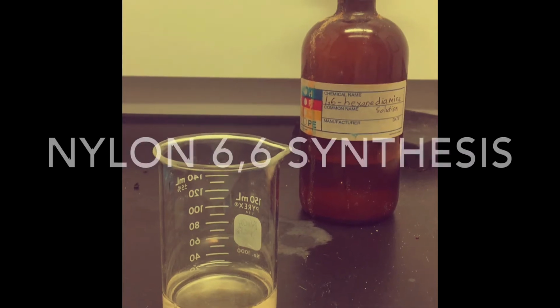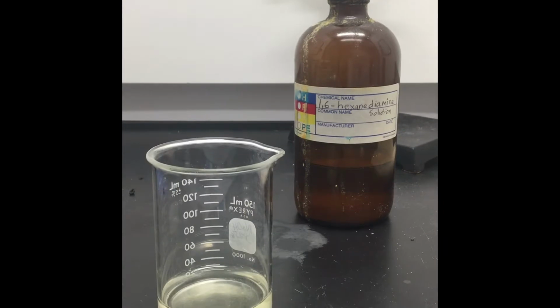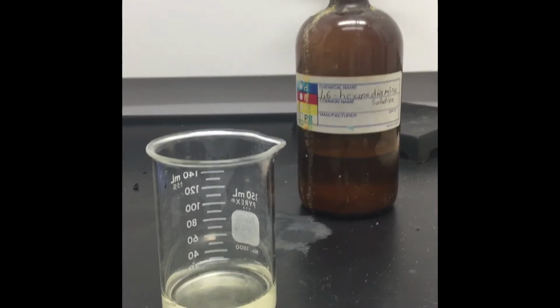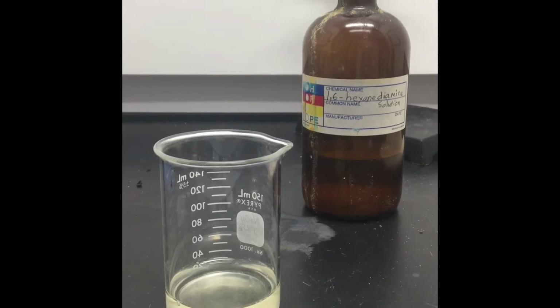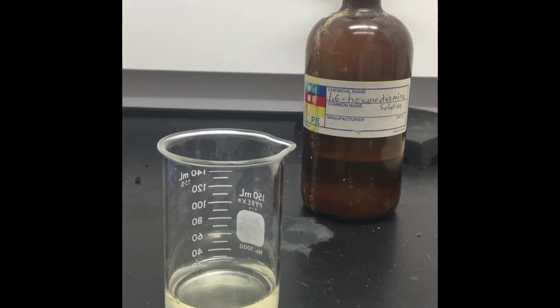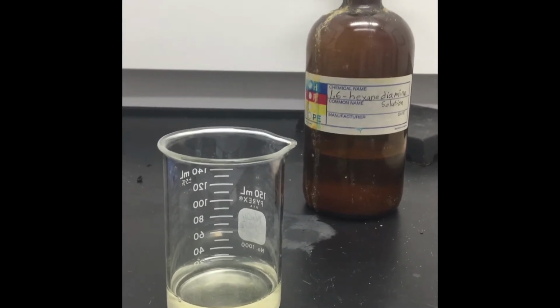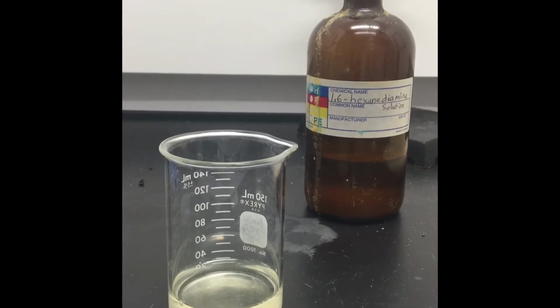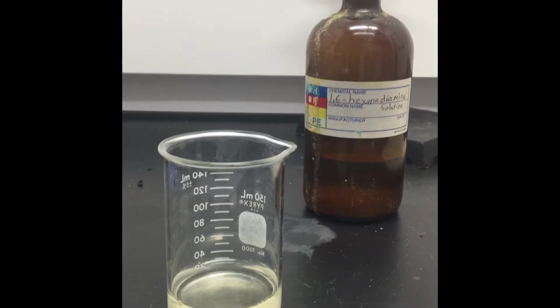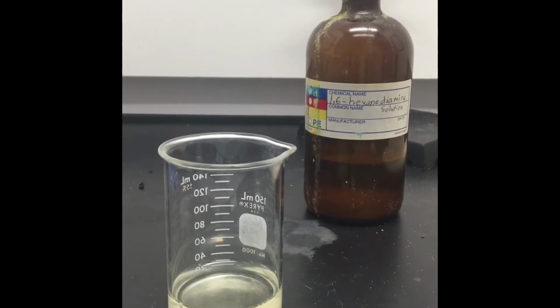Hi guys, what we're going to do right now is make a polymer. A polymer is a class of natural or synthetic substances that are composed of very large molecules. We call it polymer. Poly means many and mer means a unit. So actually a polymer has many monomers. You can think about a train that has all of these different boxcars that are bonded together. That's what a polymer is.